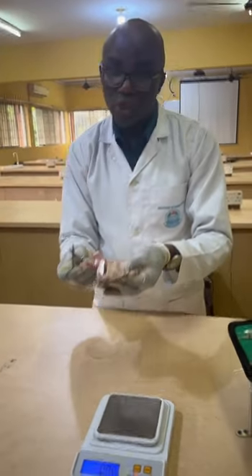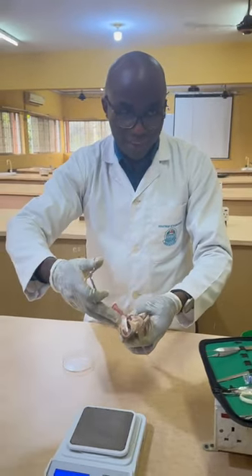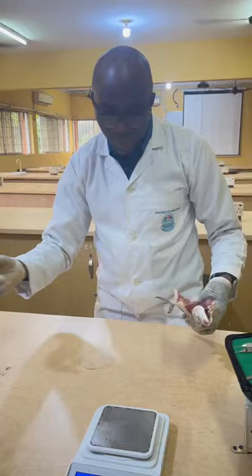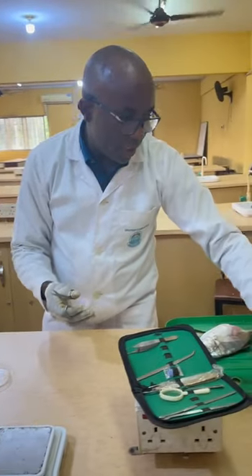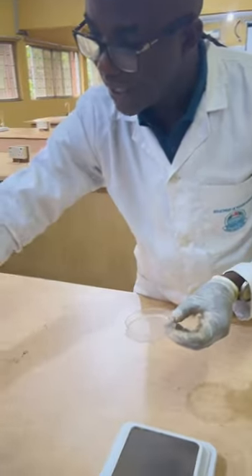All right. But if it has egg, what we do is that we cut the gonads. We cut the two gonads at the point of connection with the body. You cut them and you bring them to the measuring, to the petri dish. You want to determine the weight. So we have ovary weight there. Do you see ovary weight? So you bring it here.